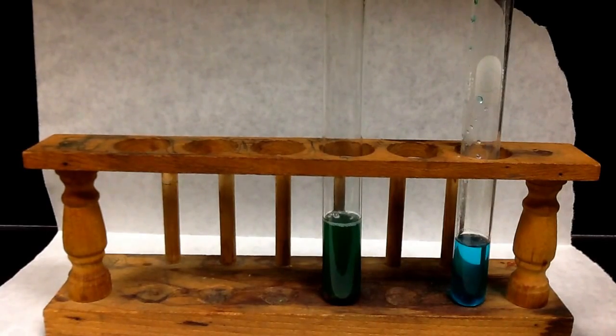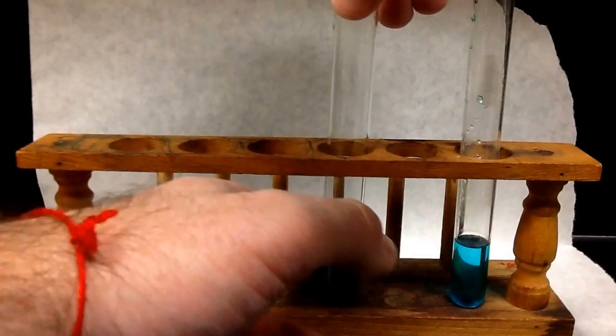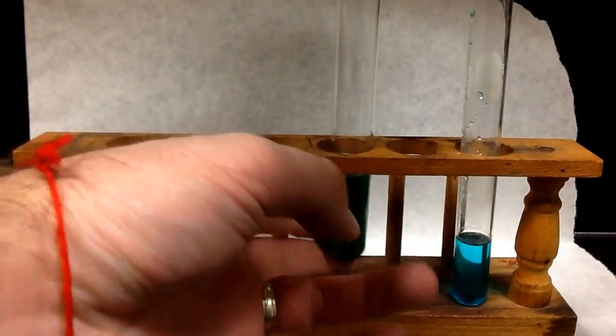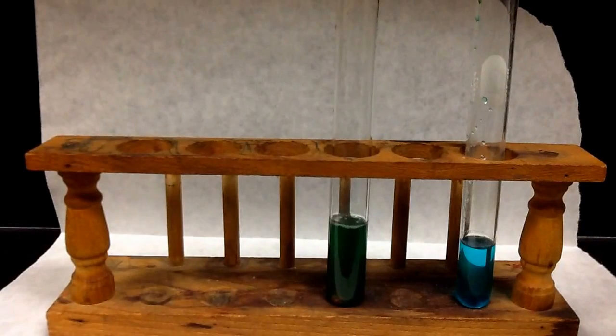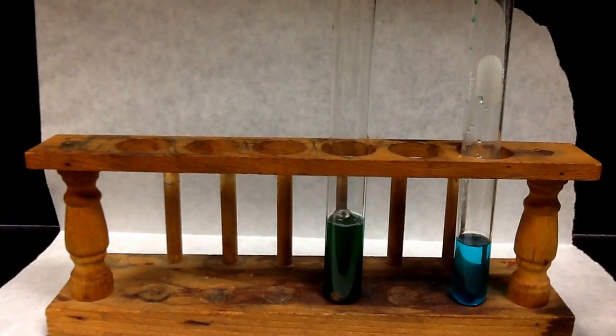So if you were to hold your hand on the bottom here, on the side there, it gets so hot that you wouldn't want to hold your hand on there for very long.